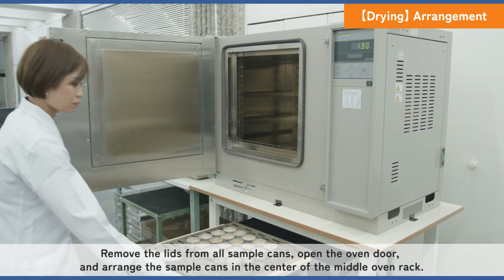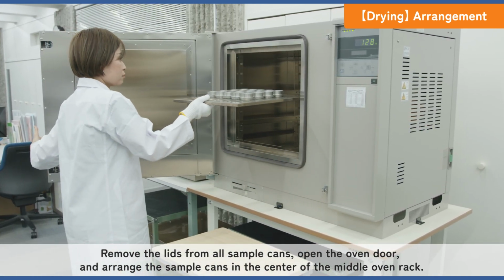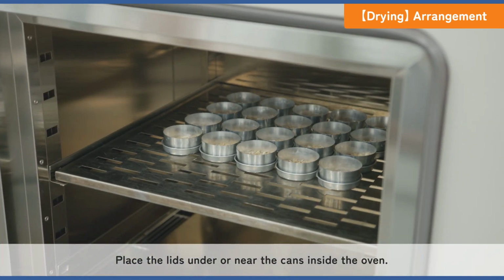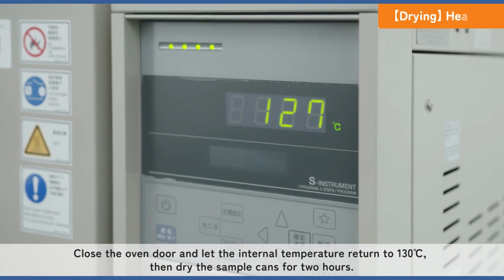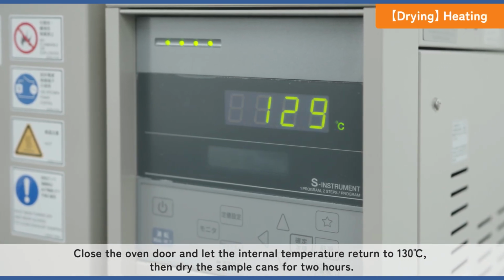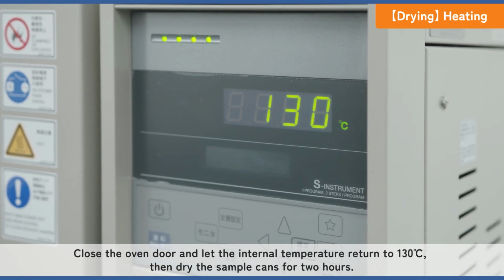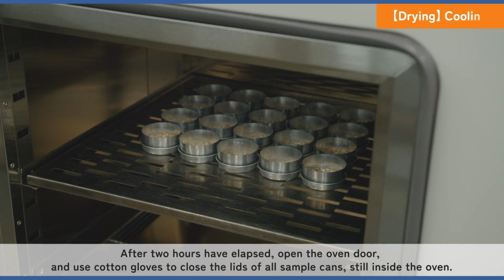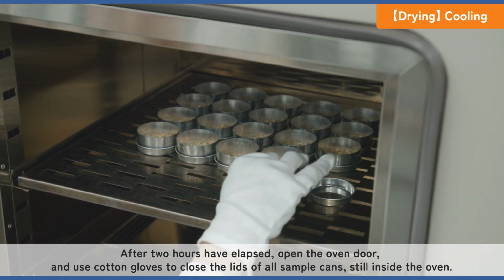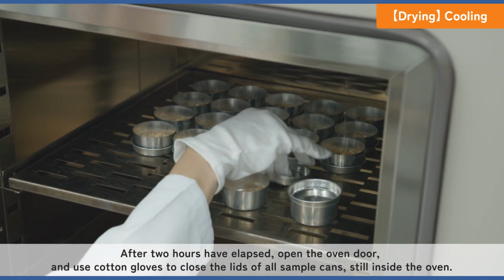Open the oven door and arrange the sample cans in the center of the middle oven rack. Place the lids under or near the cans inside the oven. Close the oven door and let the internal temperature return to 130 degrees Celsius. Then dry the sample cans for 2 hours. After 2 hours have elapsed, open the oven door and use cotton gloves to close the lids of all sample cans, still inside the oven.